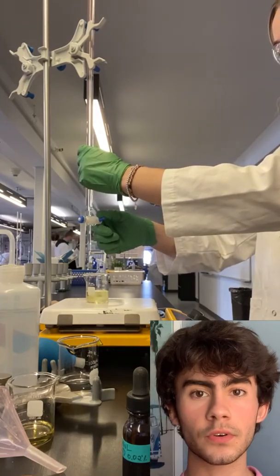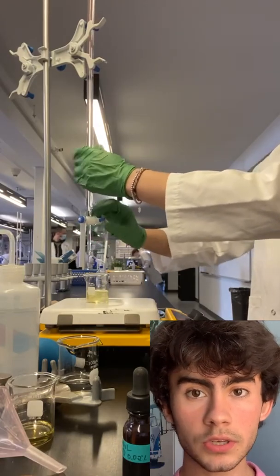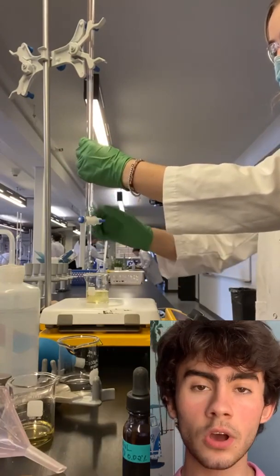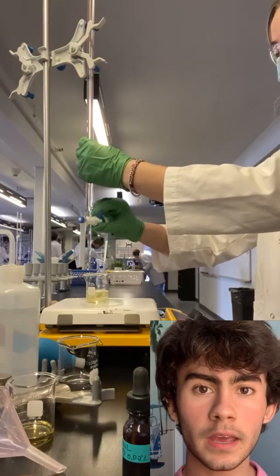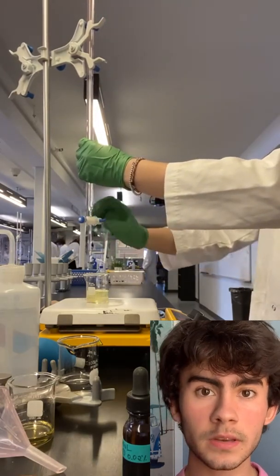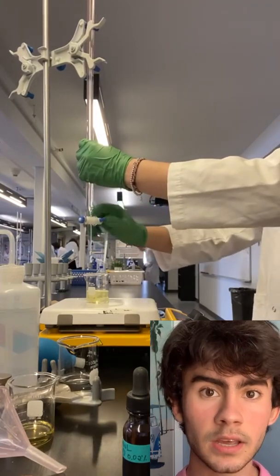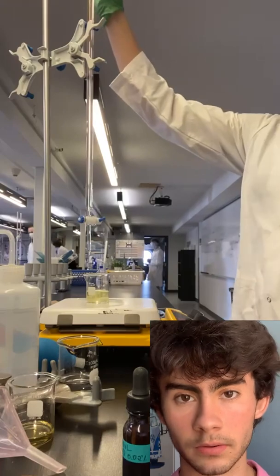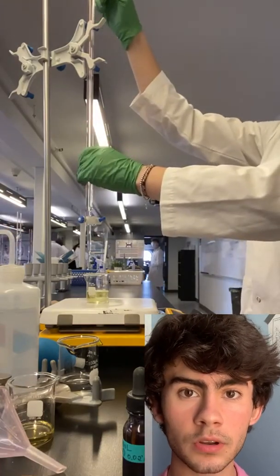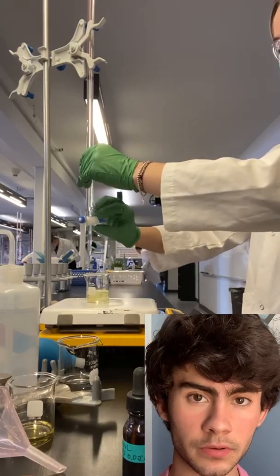The purpose of this first part of the Biodiesel Lab was to titrate two analyte samples with a known concentration of potassium hydroxide in order to determine the amount of free fatty acids, also known as FFAs, in a sample of used vegetable oil, and then with this information to figure out the amount of potassium hydroxide needed as a catalyst to convert this used vegetable oil into biodiesel. In addition, it is very important to determine a precise amount of catalyst in order to avoid an unwanted chemical reaction that occurs during the transesterification process.